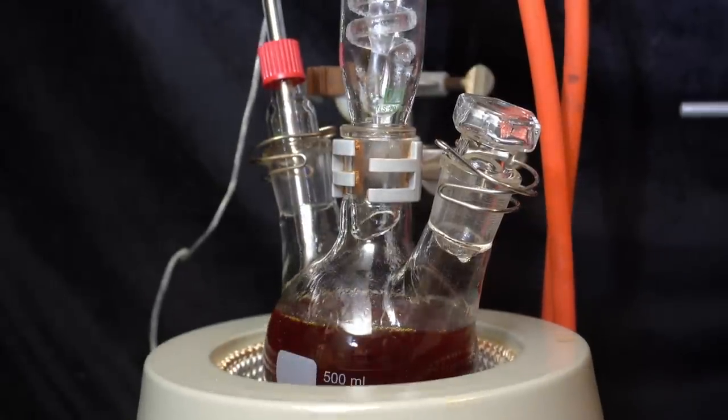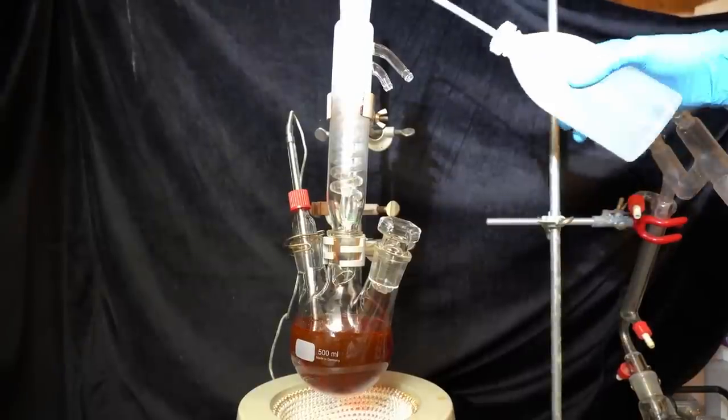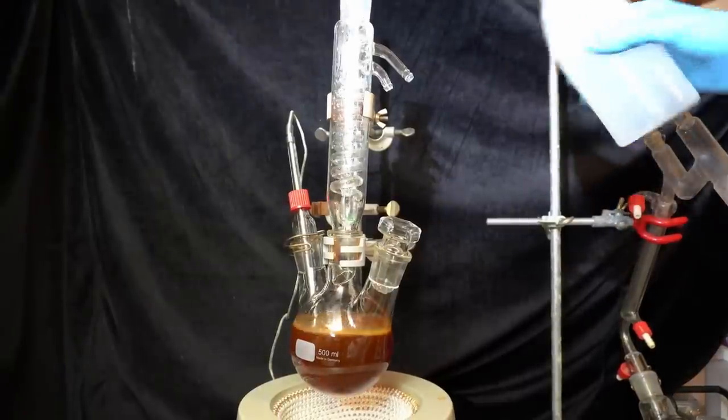After another hour I decide to continue with the procedure and simply hope that the majority of salt has been converted.